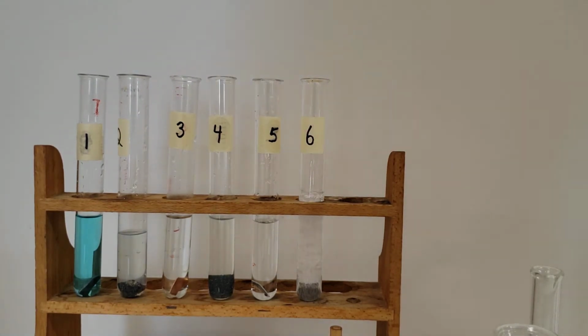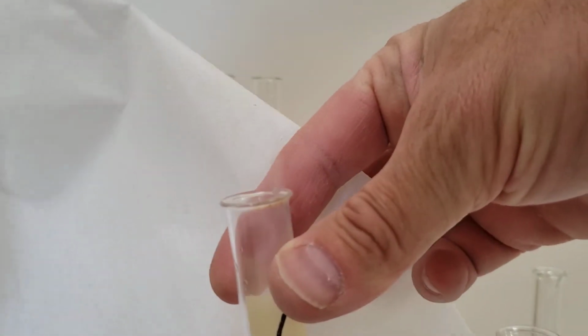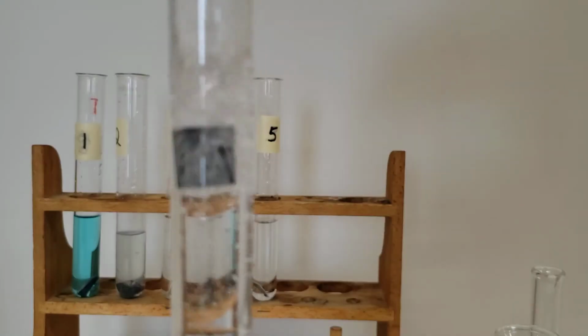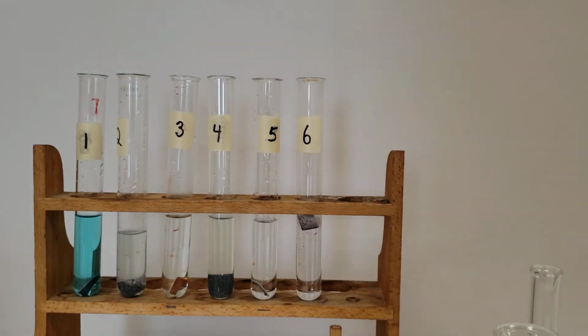Oh, yes, look at that. So that's number 6. And we'll take a look back at each of the other ones too here, just to make sure we didn't miss anything.